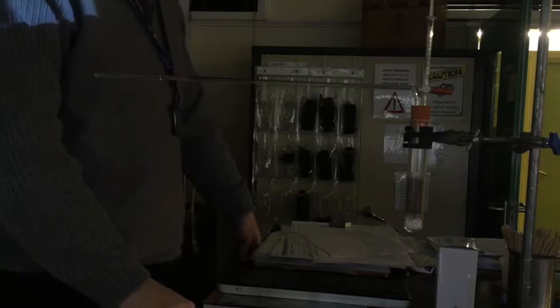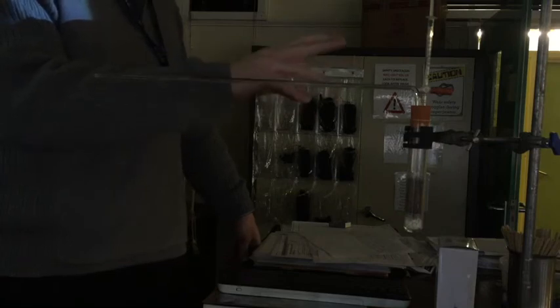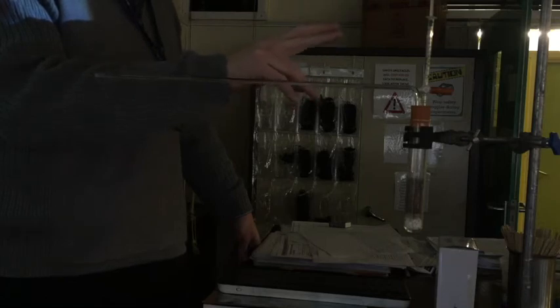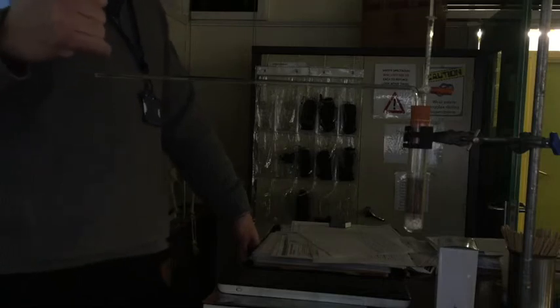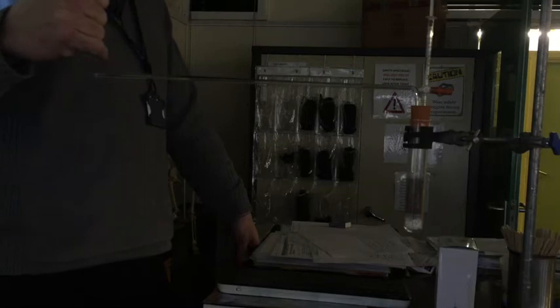We've also got a syringe. The only purpose of the syringe, and you shouldn't need to use the syringe today, is to reset this. Under no circumstances, without my supervision, touch the syringe, because if you touch the syringe and you do it wrong, you will push the red dye out of the capillary tube and the experiment won't work, and all these have been pre-set up for you. The red dye here is put in just by a syringe into the end, and so it's a tricky procedure which is why we've done it before.